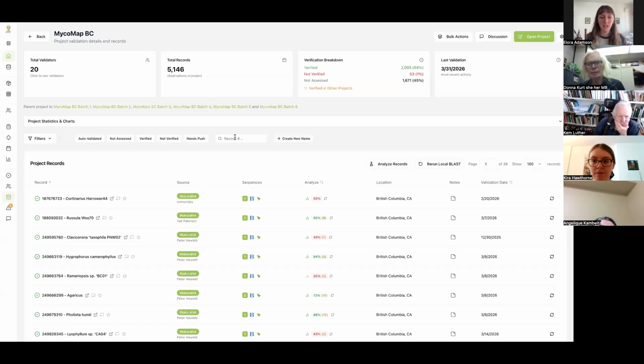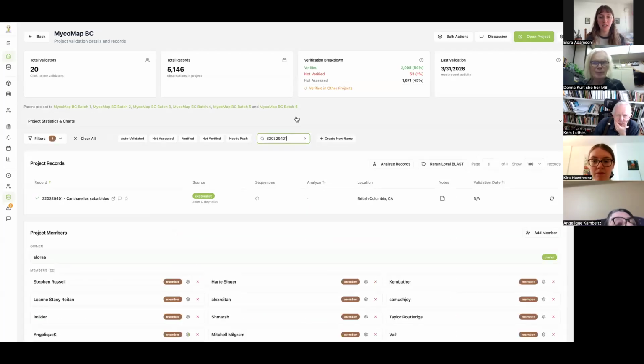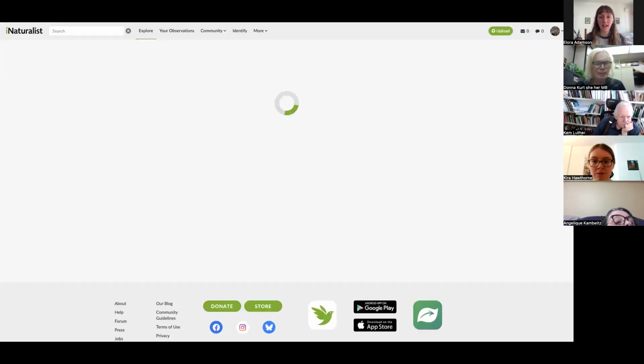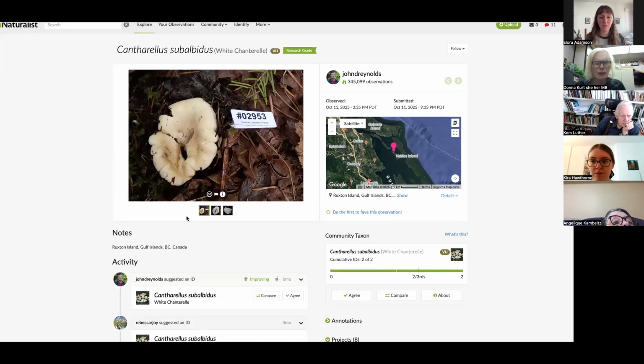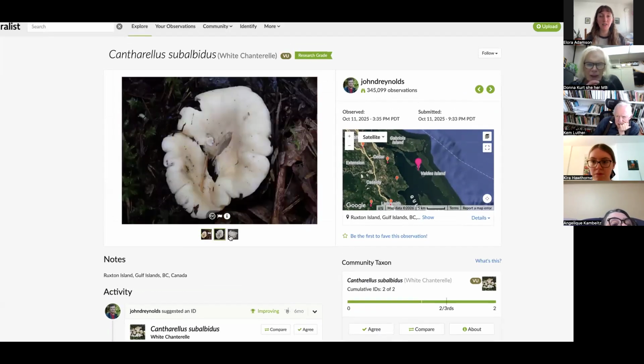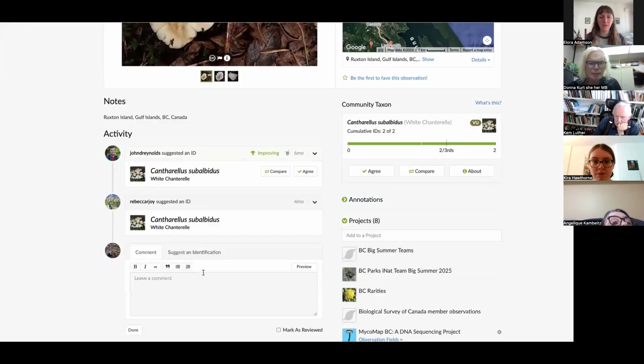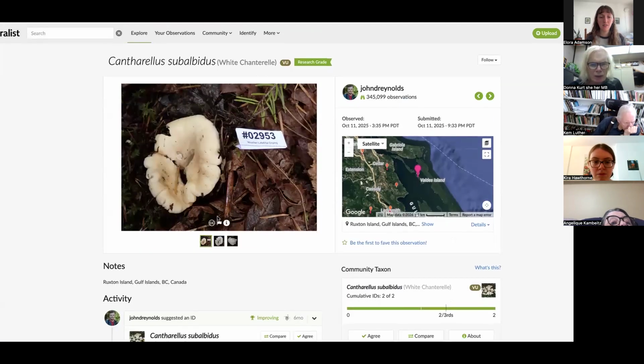Okay, so I'm going to put this number in, and here it's found our iNat. Right, because we're recording now, I'll just show it's in batch one. Pardon? It's in batch one. Okay, batch one. I'd be surprised, really. I think it was.